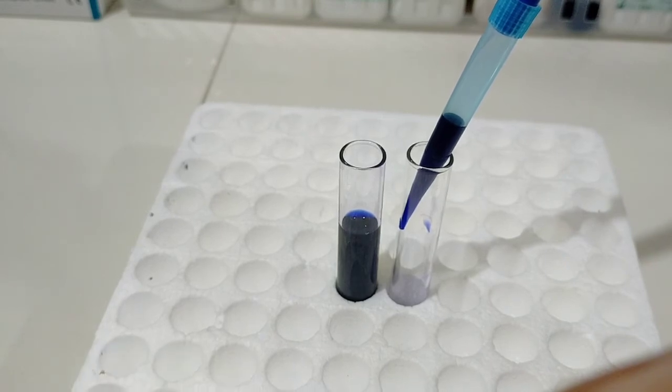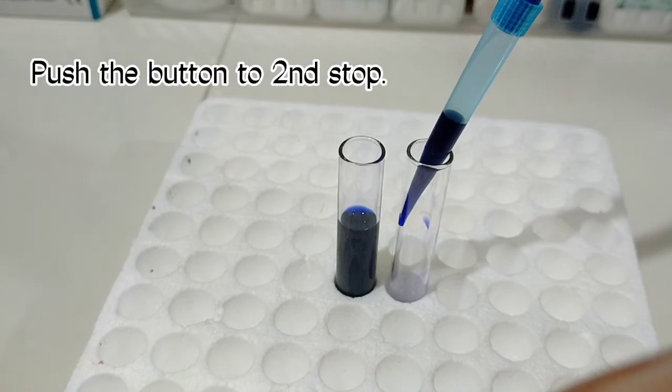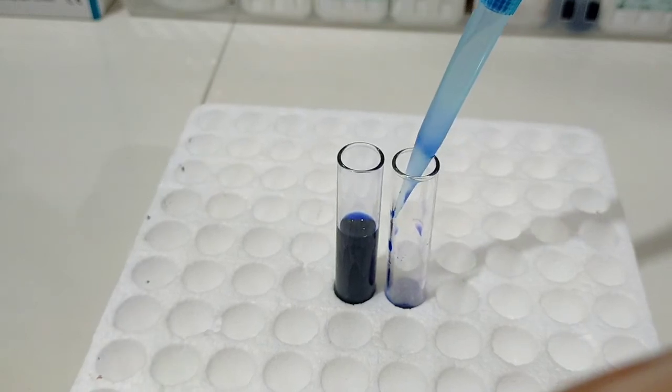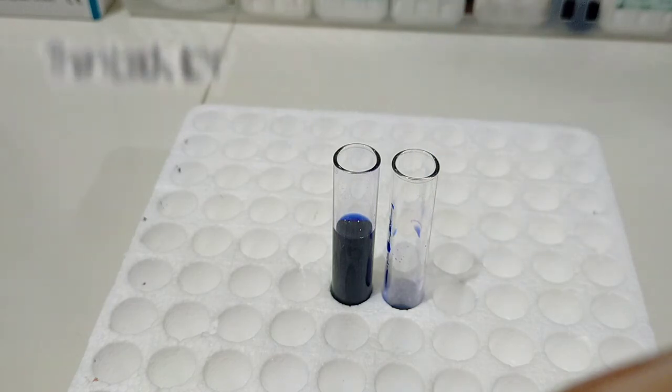Next is the purge. Push the button to the second stop to release all the liquid. So, second stop immediately, and then go back to the resting position. That is how you aspirate liquid solutions using an automatic pipette.